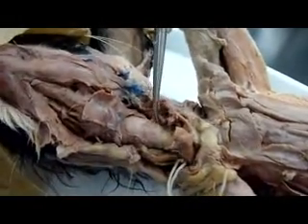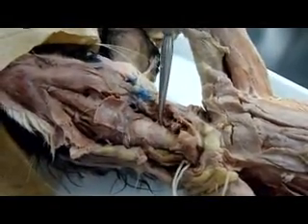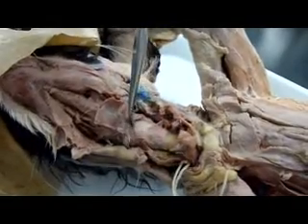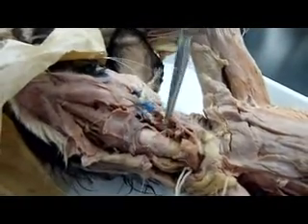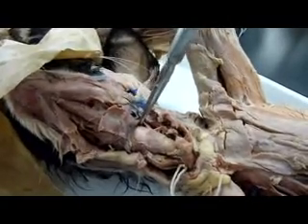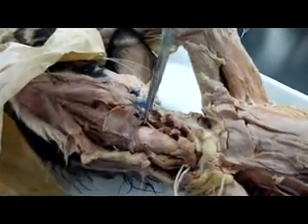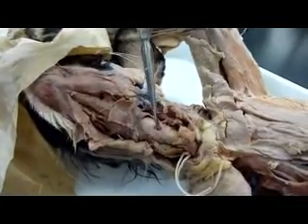And then up here, this is sternothyroid. And then this is thyrohyoid. All of this down here is sternothyroid. This is thyrohyoid. And then cricothyroid.